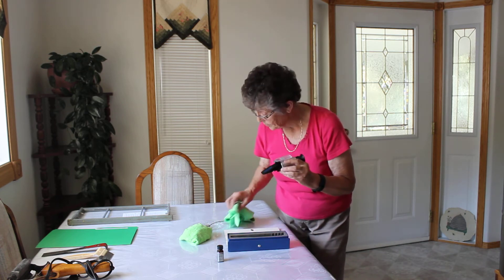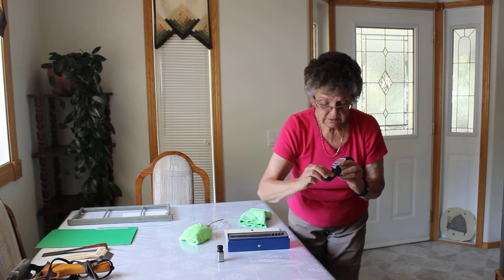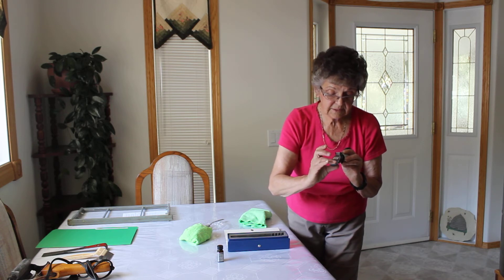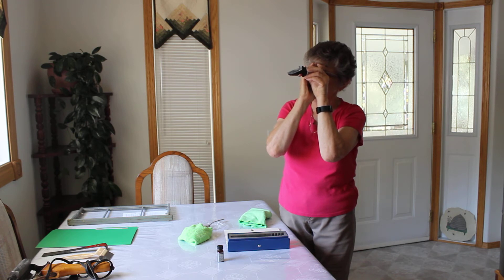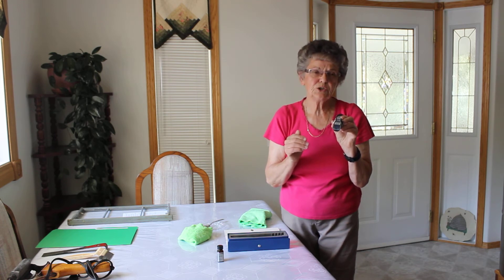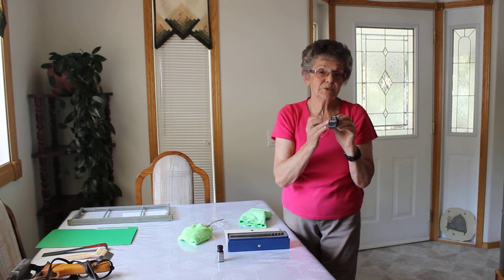Then you put on a little bit of honey — just enough to cover that lens in the middle — and then you put this down. You put it in the light towards the light and then you check and see what it is. This honey is at 17%. If it's over 18 — 18.2 — it is a problem, and you want to mix some very thick honey with it to bring it down to 18%.